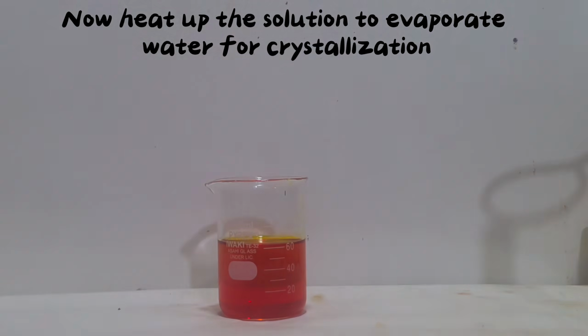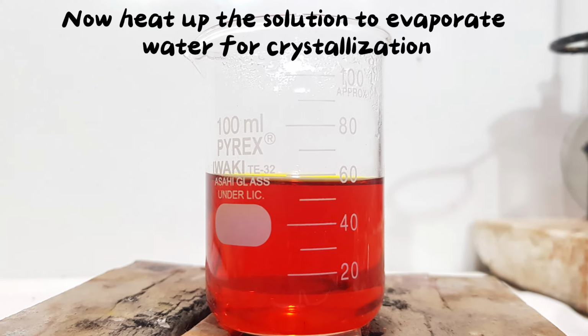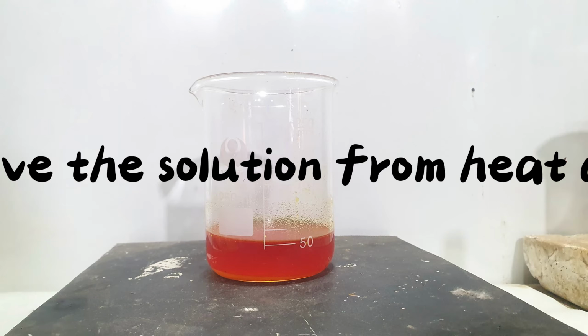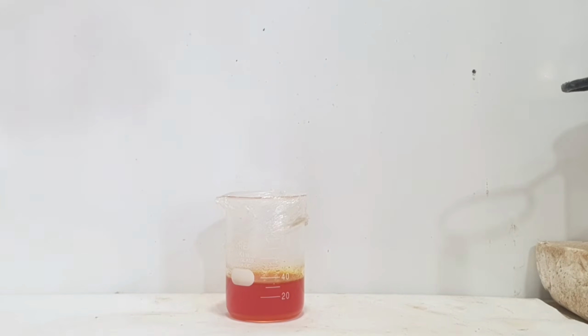Now heat up the solution to evaporate water for crystallization. One hour later. When the crystals start forming, remove the solution from heat and wait for the solution to cool down. A few minutes later.